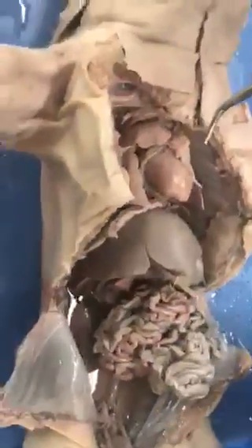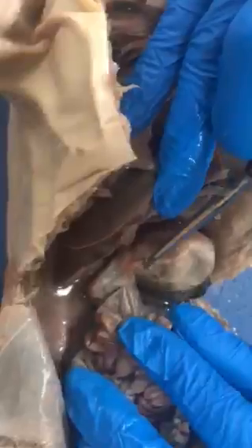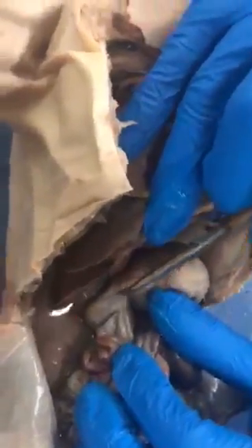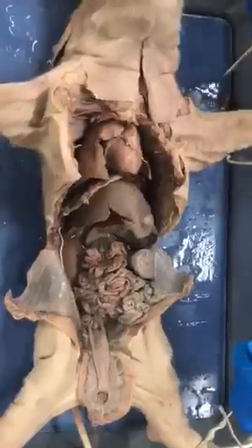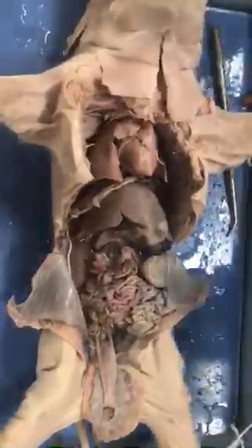And where was the duodenum again? The duodenum is the first part of the small intestine. So stomach is this deflated basketball. Pyloric sphincter is the hardened, enlarged structure coming off of it, and then where it gets narrow is the duodenum. Okay. And then that's it? Yeah, you guys can check and make sure I didn't miss anything, but I tried to be very thorough for Kelly.